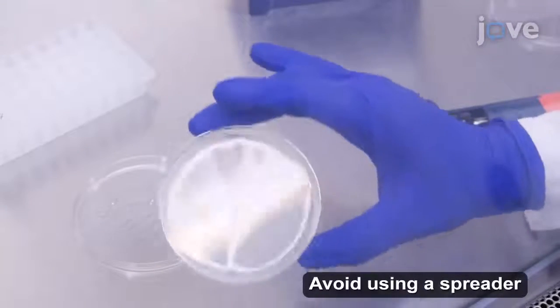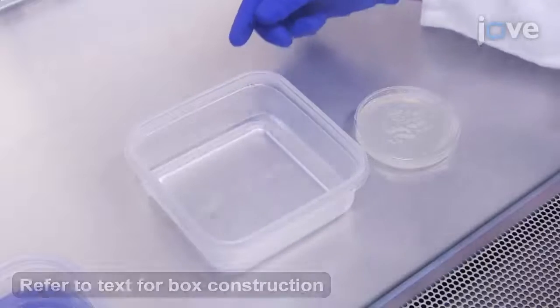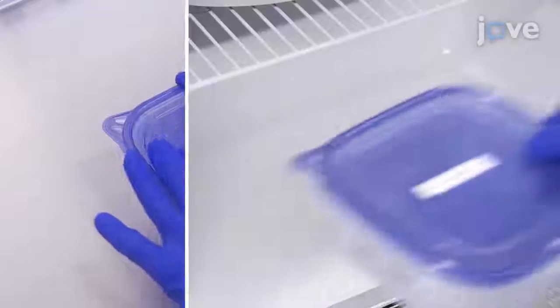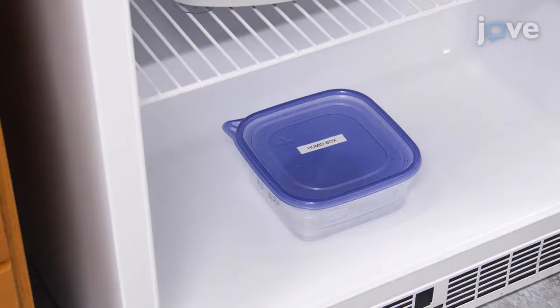Tilt the plate to spread the culture evenly on the surface of the plate. Then, place the plate in a box that maintains high humidity. Incubate the plate inside of the box at 22 degrees Celsius for 4 to 5 days.